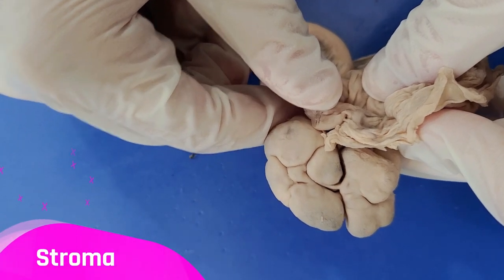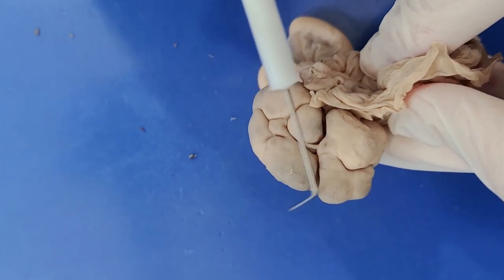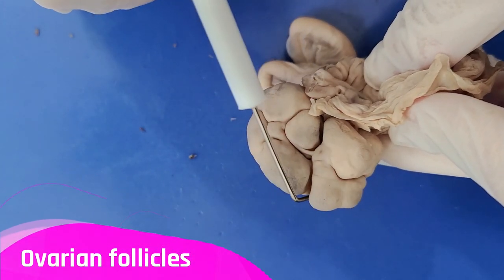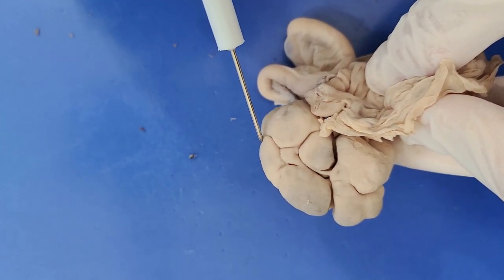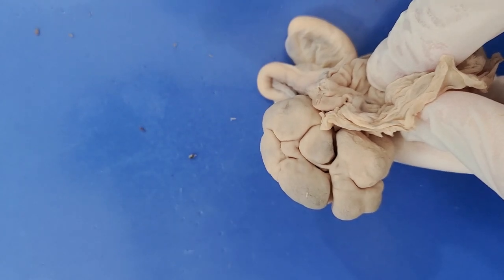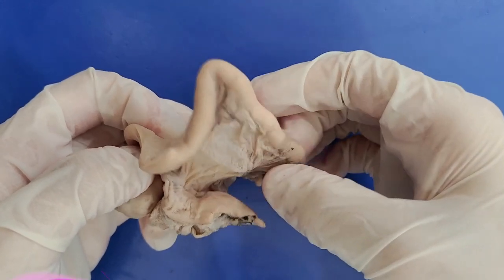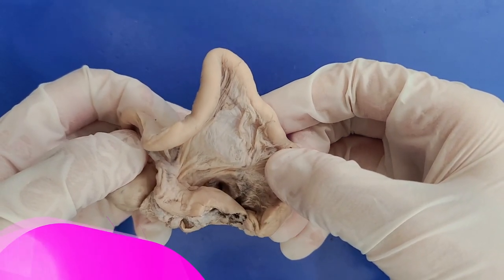You can see these bumps on the surface of the stroma, and these are actually the developing follicles pressing up against the ovary wall — we'll discuss this more soon. Also, this tube-like structure you see here is the oviduct, which is where fertilization takes place.